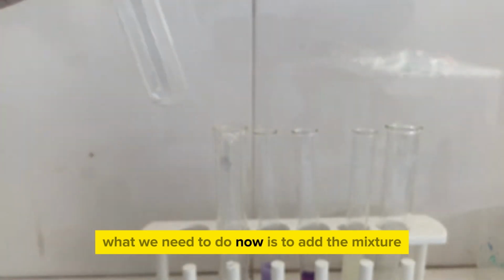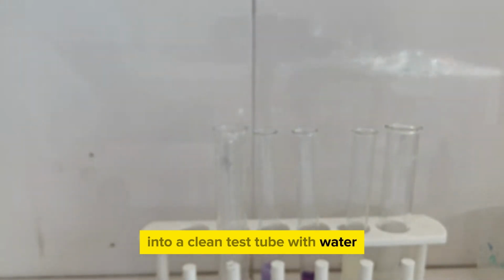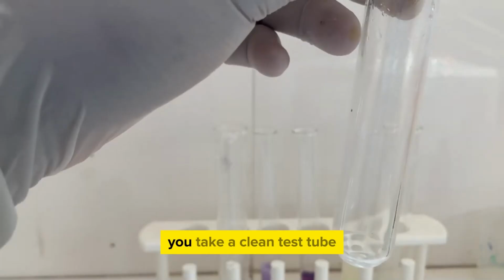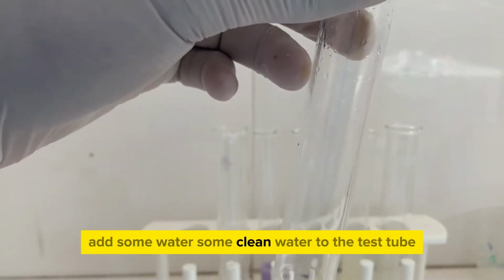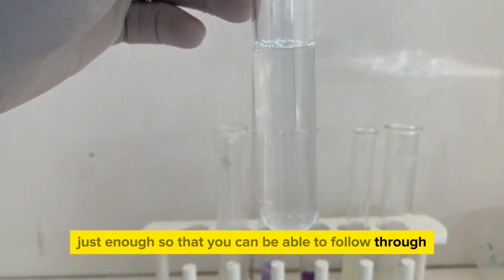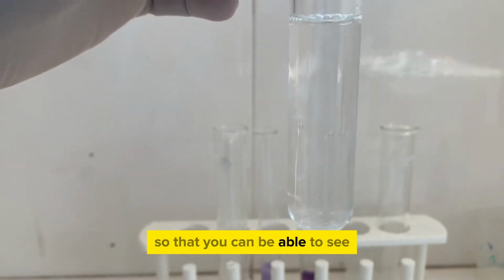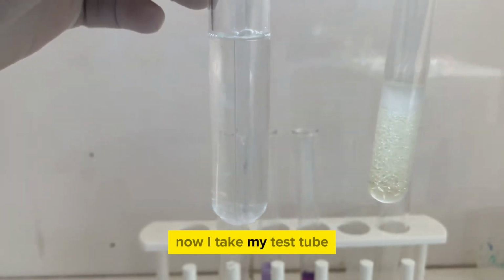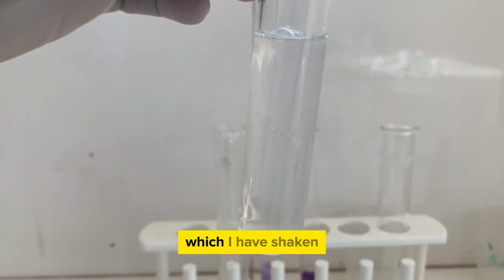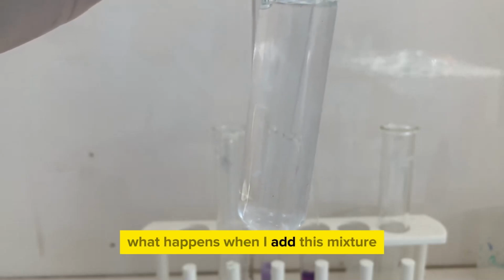What we need to do now is to add the mixture into a clean test tube with water. So take a clean test tube, add some clean water to it, just enough so that you can be able to follow through. Make it more than maybe about half, so that you can be able to see. Now I take my test tube, which has the fat and ethanol mixture, which I have shaken, and I'm going to pour. I want you to notice what happens when I add this mixture.